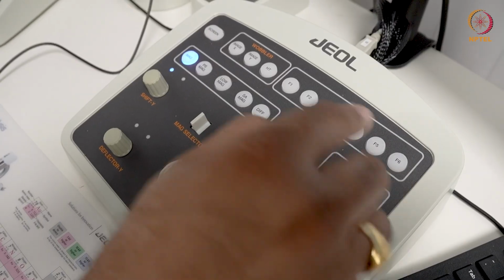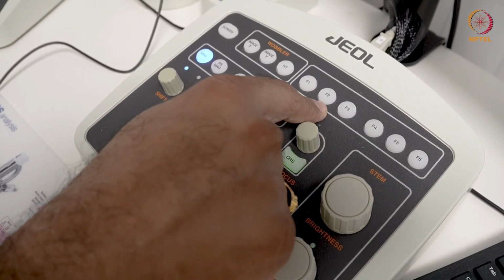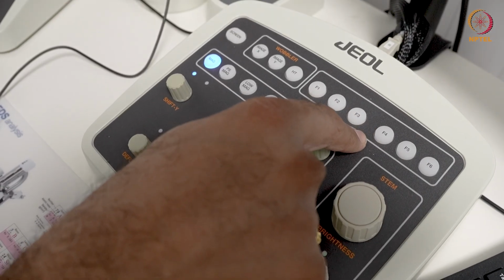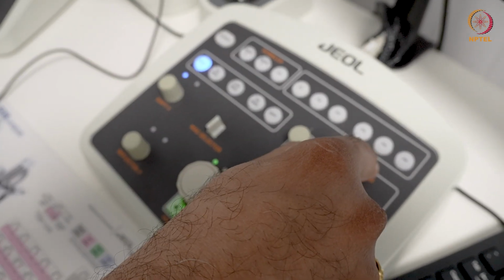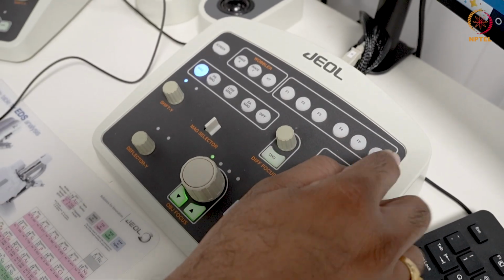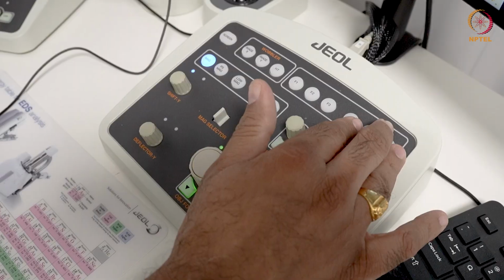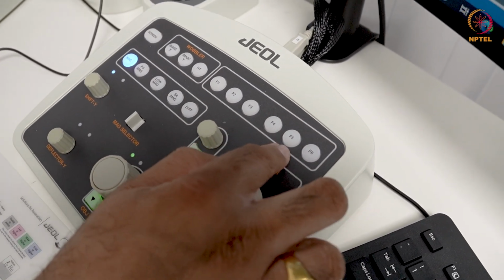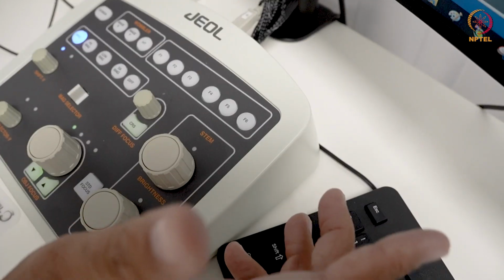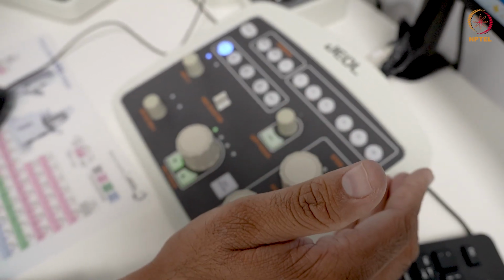For example, F1 is to go to the ronchogram. F2 is for spot alignment on this microscope. F3 is anode wobbler. F4 is gun alignment. And then F5 is beam stopper. And F6 is for scan mode. So when you do this in STEM mode, you can actually choose some of these. And the knobs F3 to F6 or F5 are for gun alignment. Depending on what is required, you can always use these knobs.